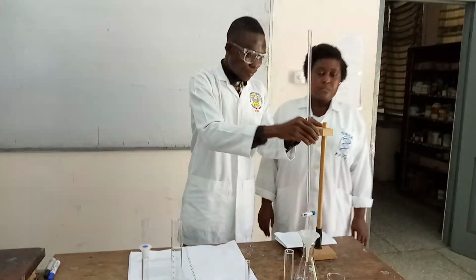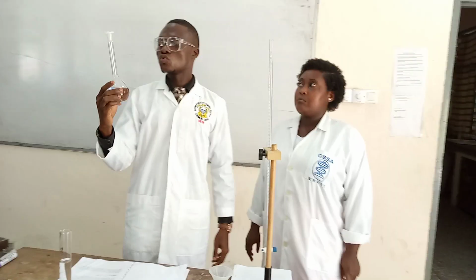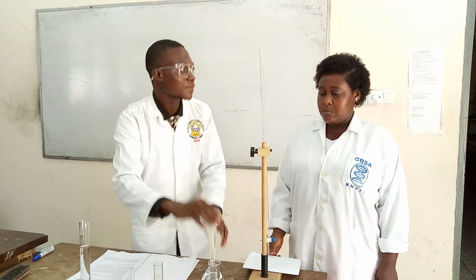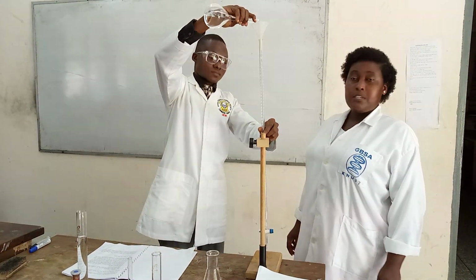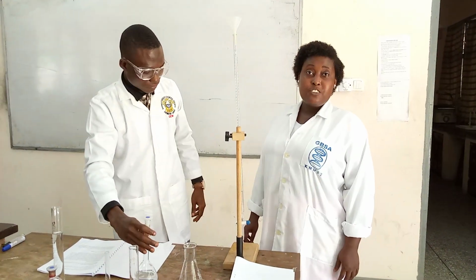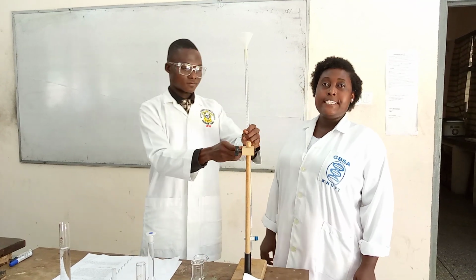And so viewers, I will proceed by taking you through the practical, and by so doing, you are supposed to fill the 0.02 molar EDTA in the burette. That is your first step, and I'm going to do that. Please just concentrate. So guys, earlier I said that the EDTA is the titrant, so it's supposed to be in the burette. So that's what my colleague is doing. He's trying to fill the burette with EDTA.